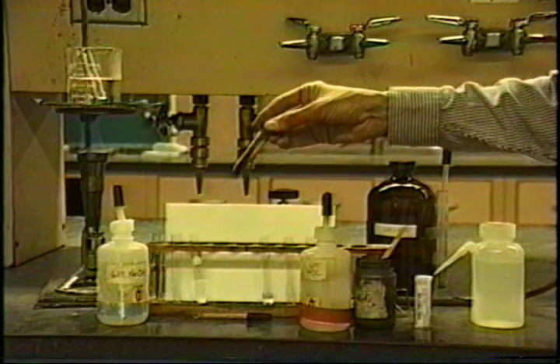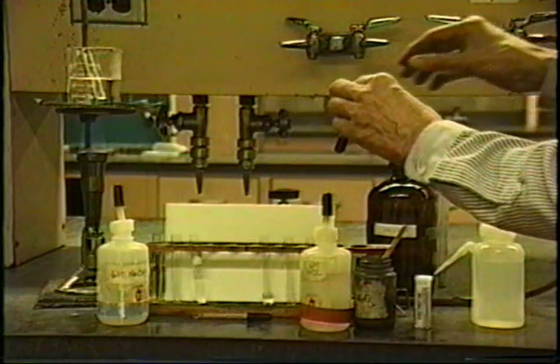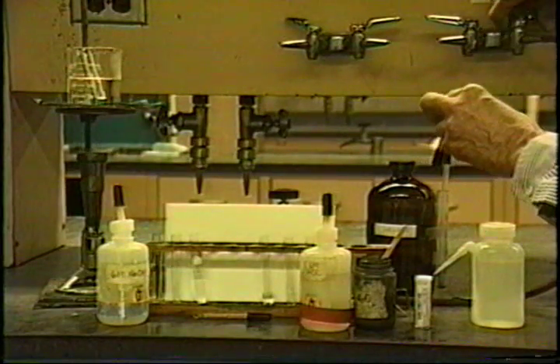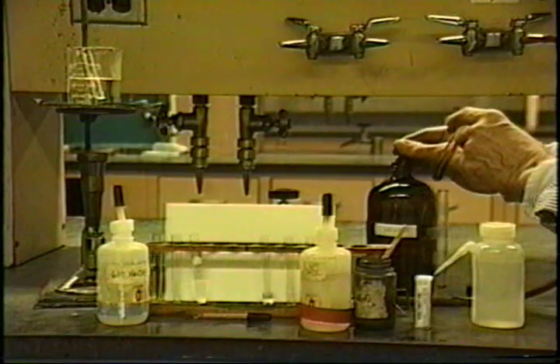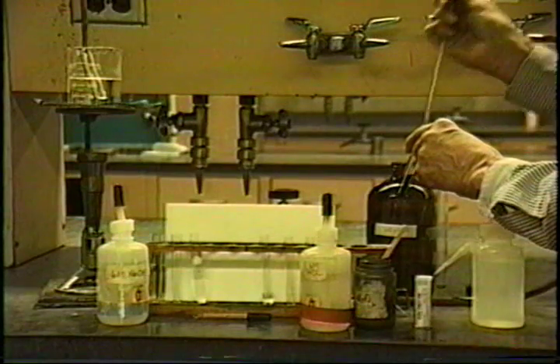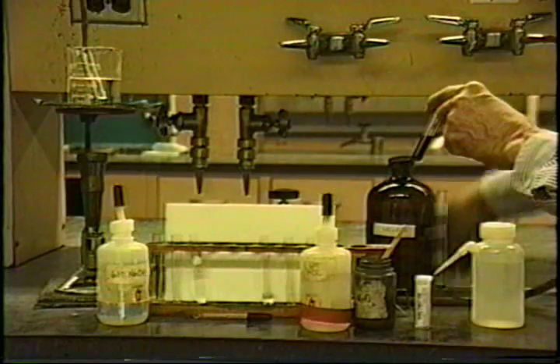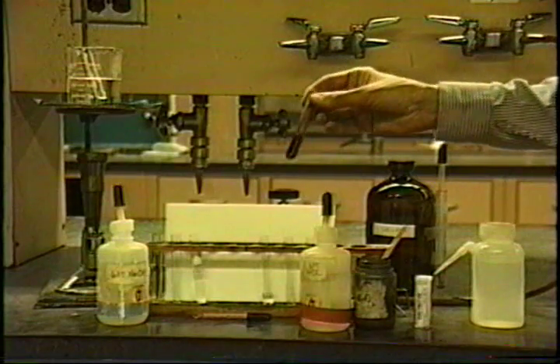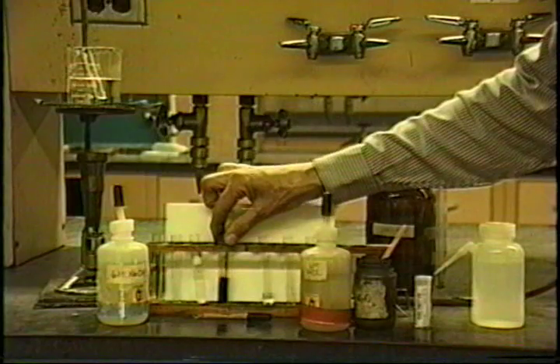Finally, we'll just do the confirmation test. It appears that it's one of the halogens which was generated here. And to do the confirmation test for halogen, we'll just add hexane. And before I add the hexane, I'll turn off the flame so I don't have a fire there. And add the hexane. Take it up. Oh, I got a pretty purple color there. Let's take a look at that in close-up.